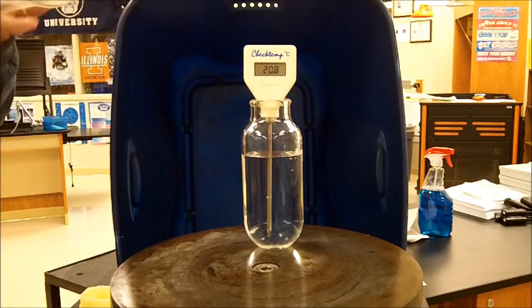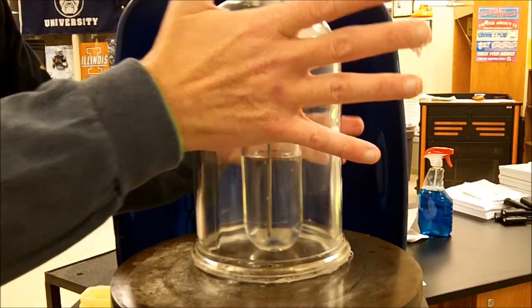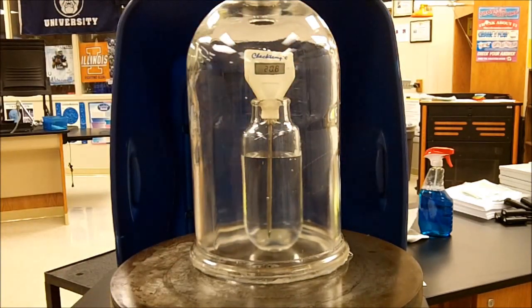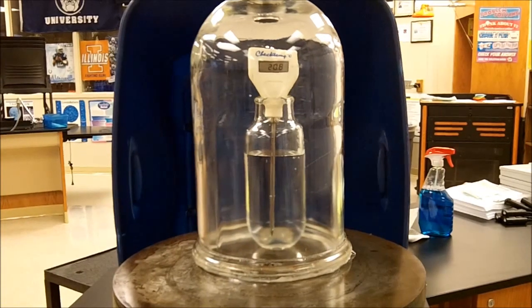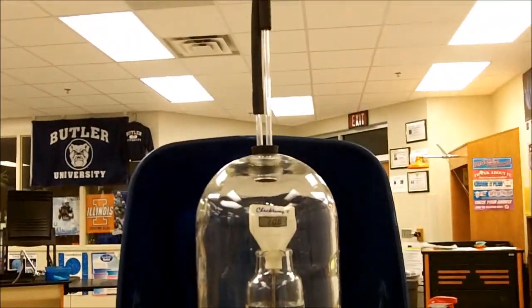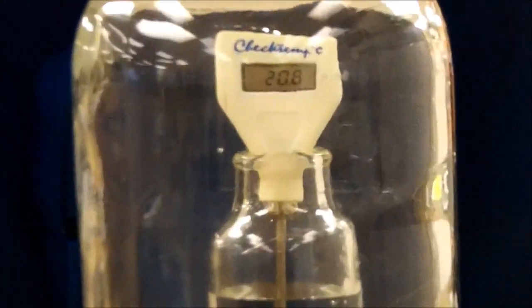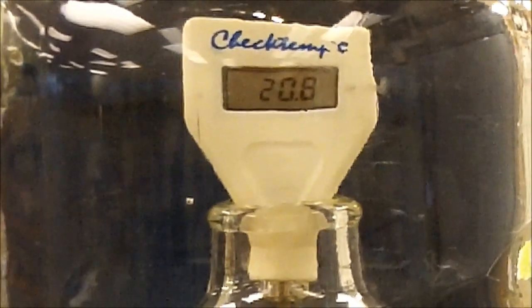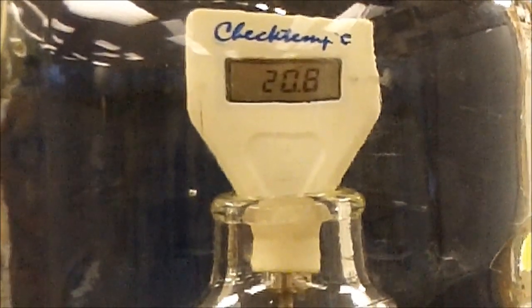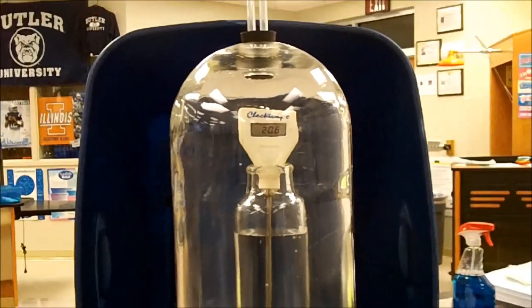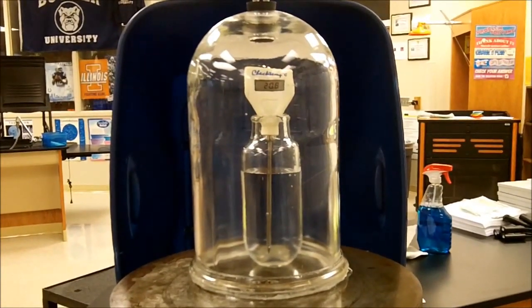Okay. So carefully, I'm going to place this on here. Did a pretty good job with that. So I believe everything's in place. Again, let's just, so there's our apparatus with the bell jar. And let me do kind of a little scan there so you can see that that's connected. Also, let's zoom in on the temperature, which right now is at 20.8. So it's a little warmer, but that's all right. But again, not 100 degrees. So obviously that's the temperature which water boils under normal conditions.